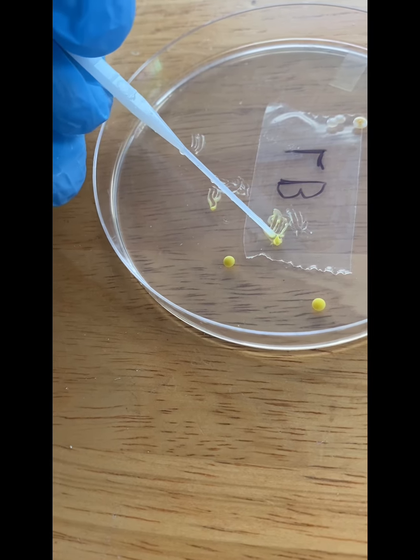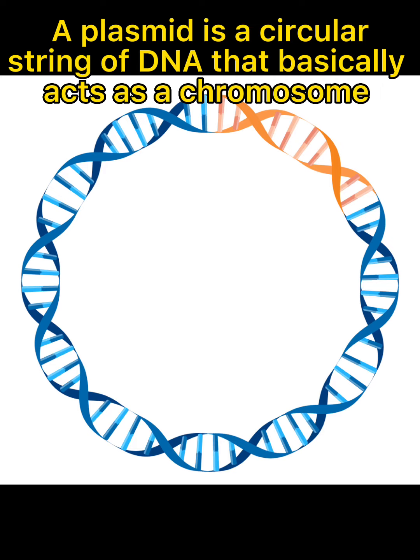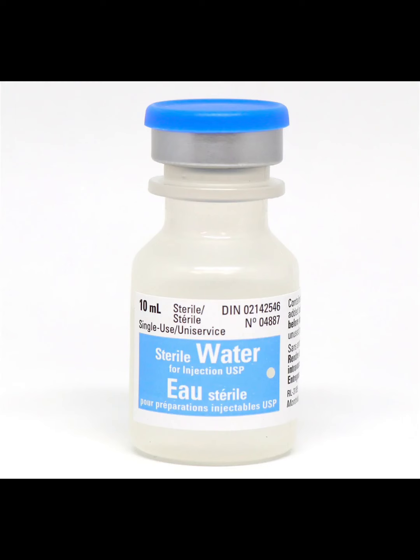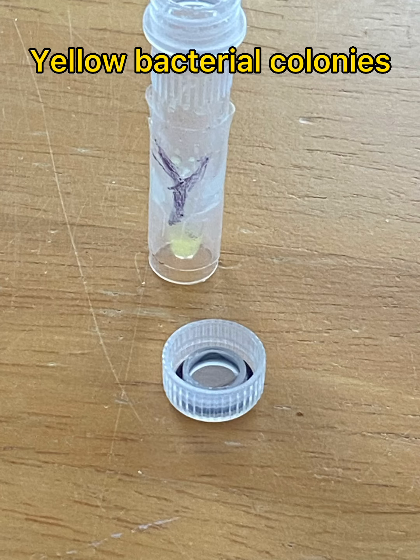This tube is going to be known as our competent cell mixture. This means that the E. coli cells can now take up plasmids and other nucleic acids which they normally couldn't. For now, we're going to put our competent cell mixture off to the side and take out a tube labeled plasmid. We're going to add roughly 2 drops of sterile water and shake the contents for 1 minute.